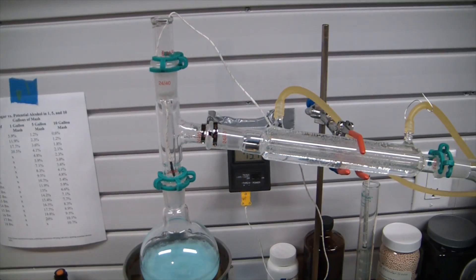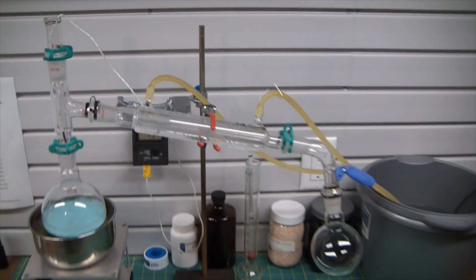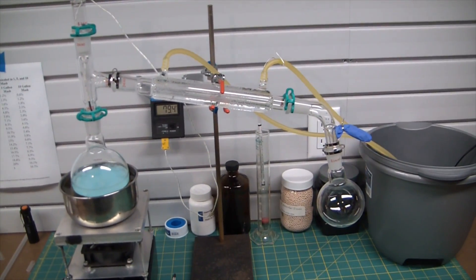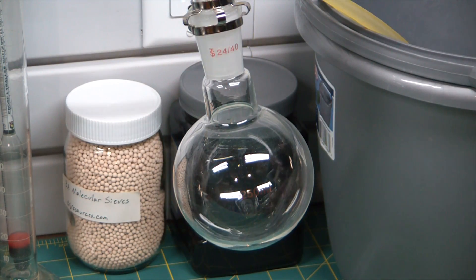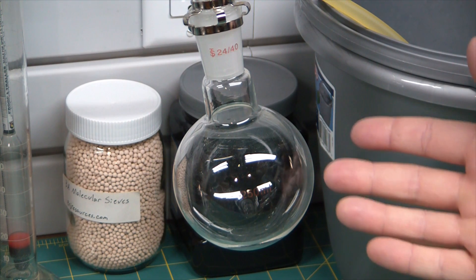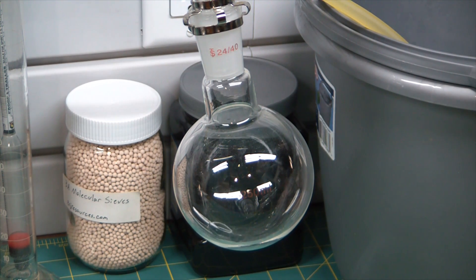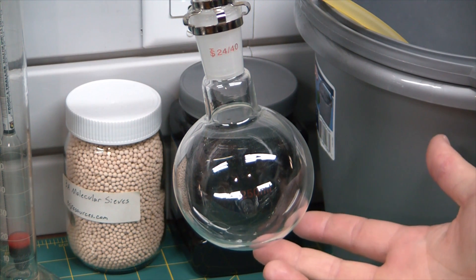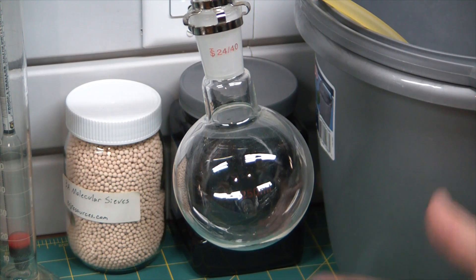Should be seeing drips very soon. The first drip! Yes, the primary drip, which as opposed to dribble is not a khaki ruiner. So a lot of people love to tell you how strong their moonshine is, but this stuff will actually desiccate your tongue if you drink it.